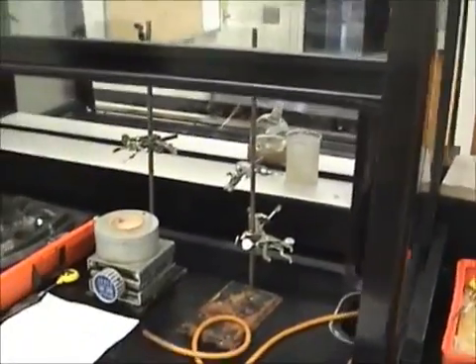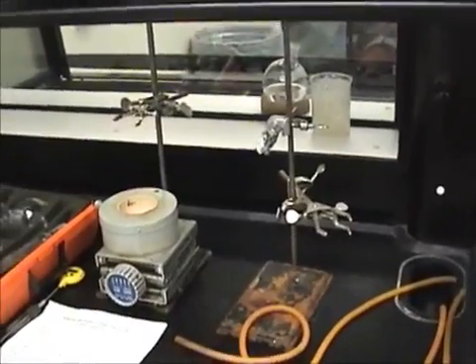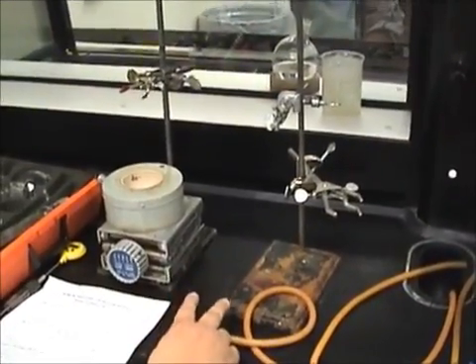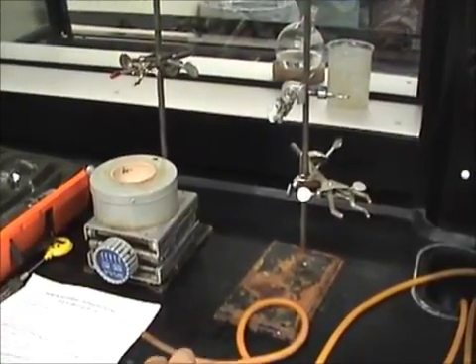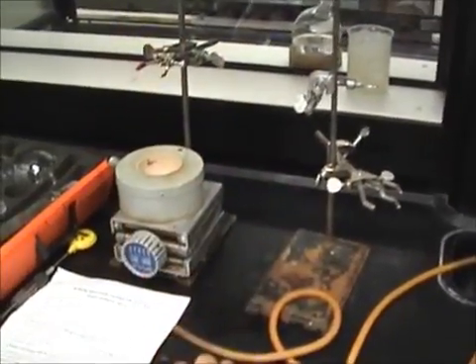Now, we are ready to begin the distillation setup. First thing we want are two proper stands inside the ventilation hood. This will provide the support needed for our distillation setup. Make sure there are two clamps per stand.